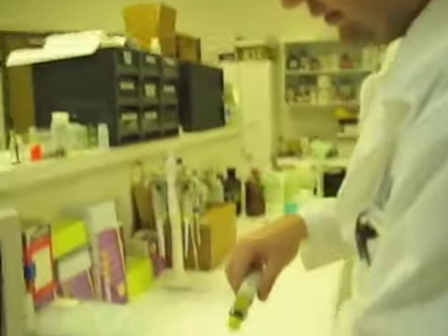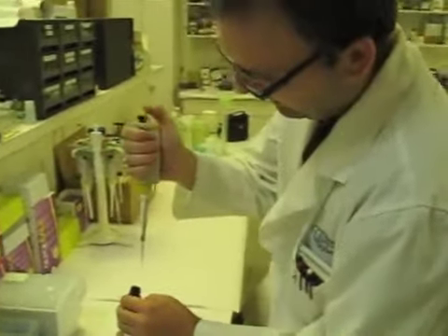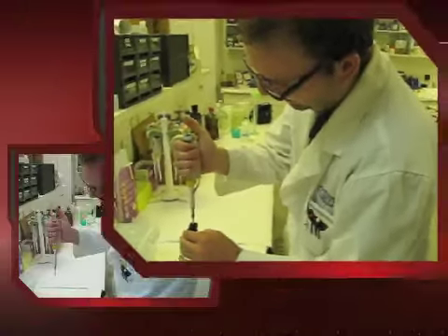I will now make a final injection of 16 microliters. This will result in 800 nanomolar final concentration.